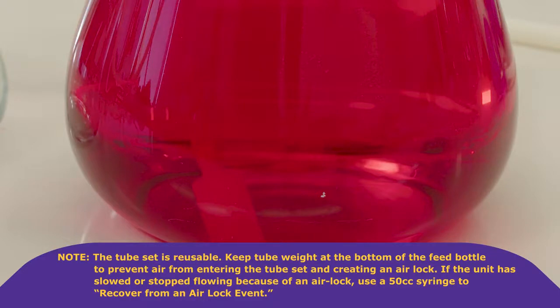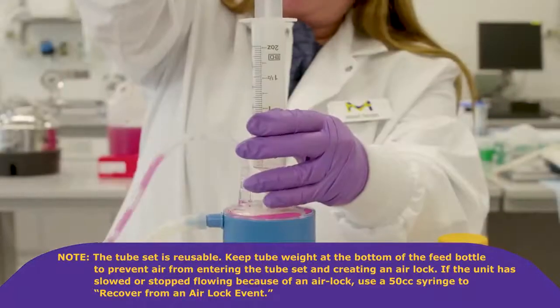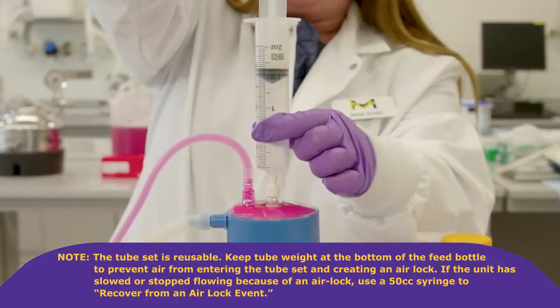If the unit has slowed or stopped flowing because of an airlock, use a 50cc syringe to recover from an airlock event.